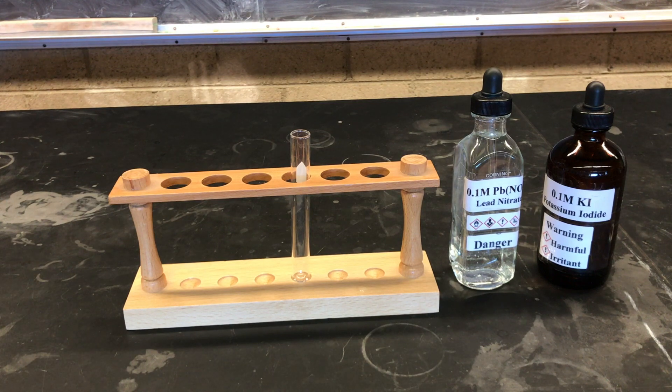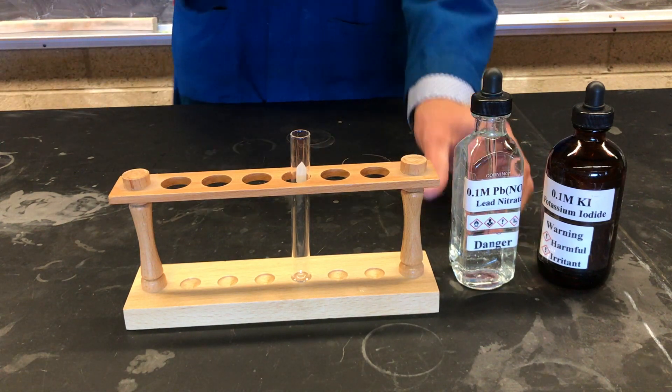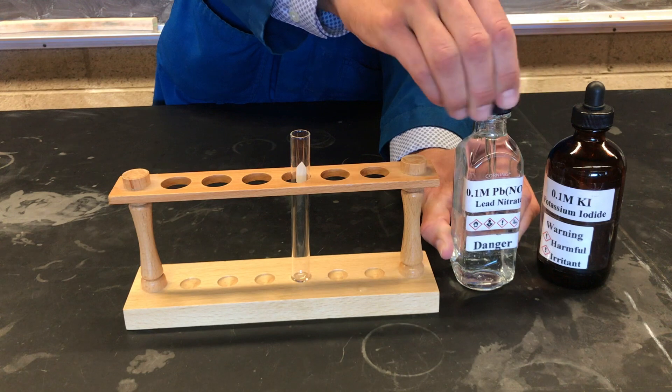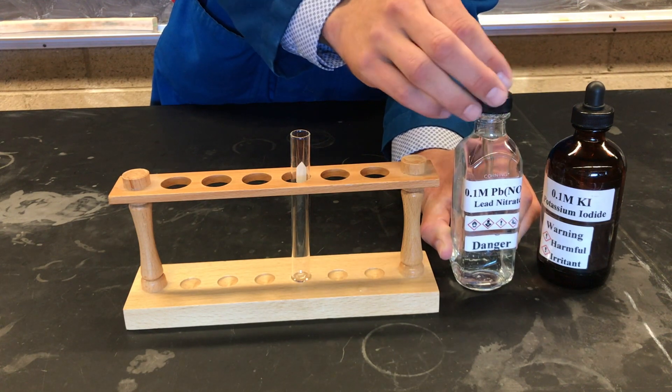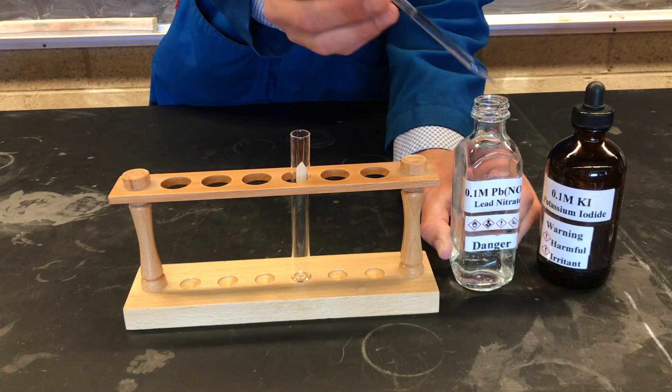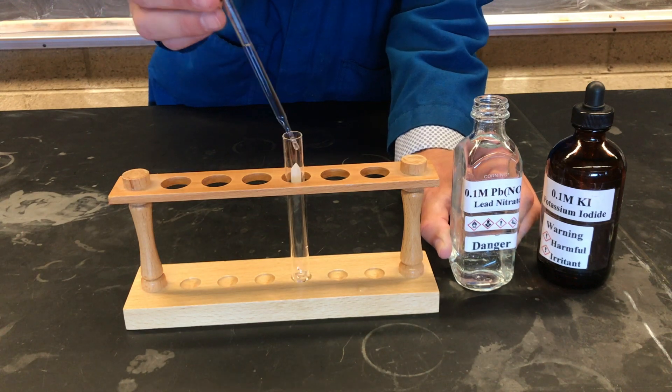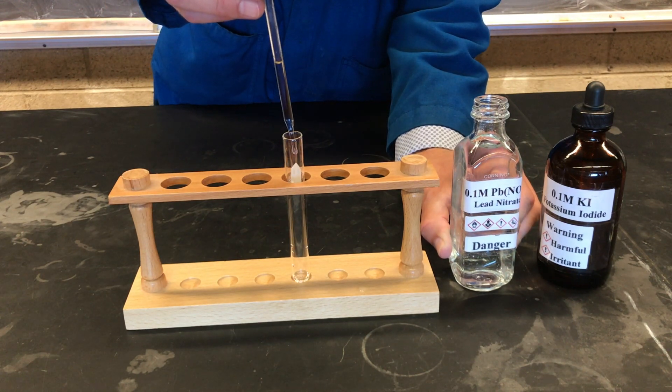This is the reaction of aqueous lead nitrate with aqueous potassium iodide. So, I'm going to carefully add 20 drops or so, it doesn't need to be exact.